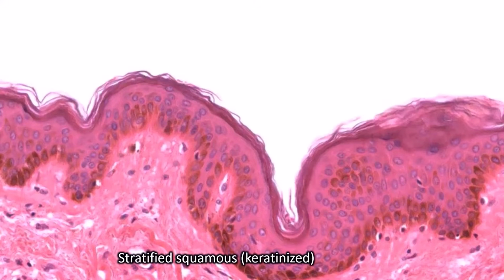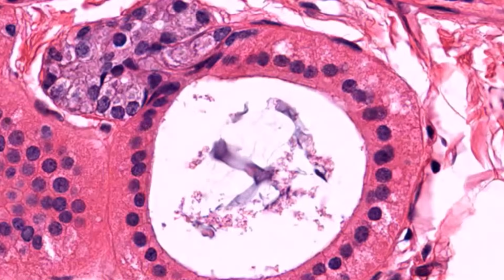So you may have thought that this one was transitional because it's multiple rows of nuclei and it doesn't look squamous. However, sometimes keratinized stratified squamous doesn't actually have cells that look clearly squamous, but you always see a kind of flaky top. Once you see that flaky top, which is the stratum corneum, that is your hint that this is keratinized stratified squamous, not transitional.